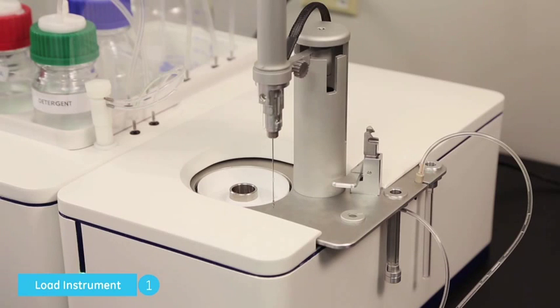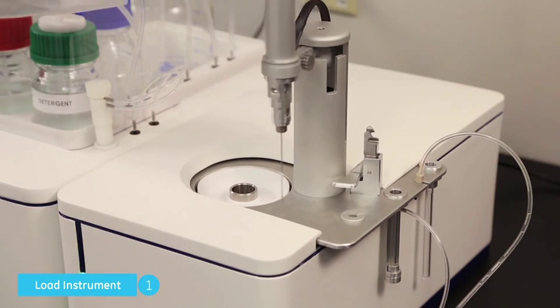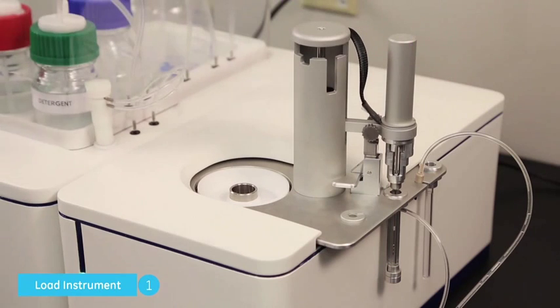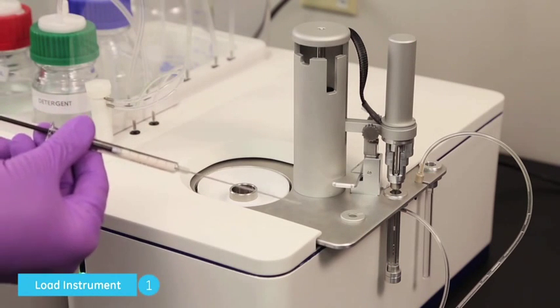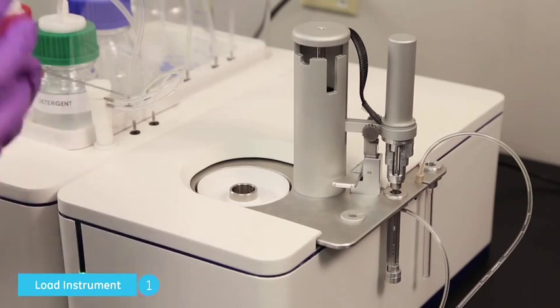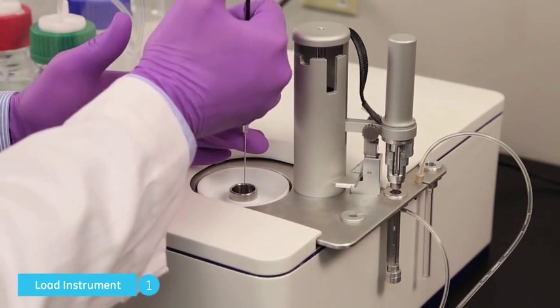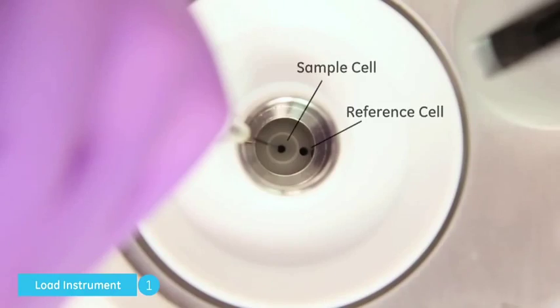The pipette should be moved out of the way, for example to the clean location. Fill the loading syringe with about 300 microliters of sample. Slowly insert the loading syringe into the sample cell port and hold it about one millimeter from the cell bottom.